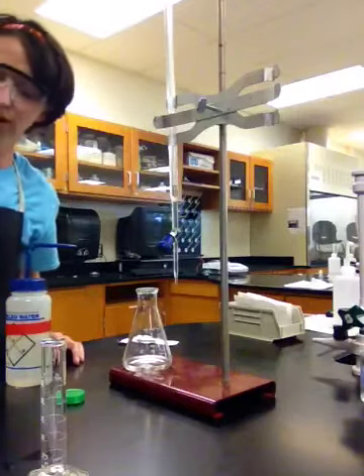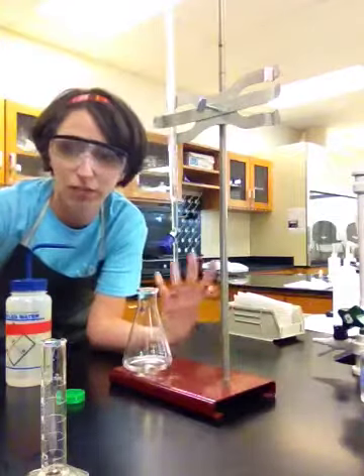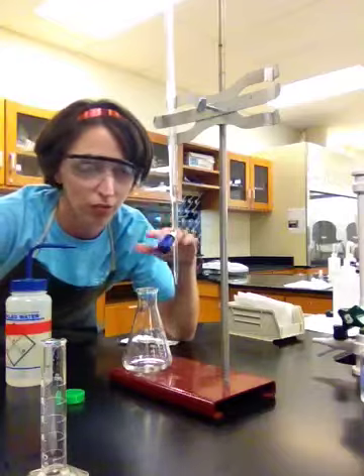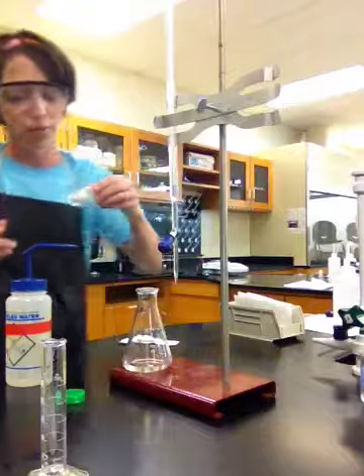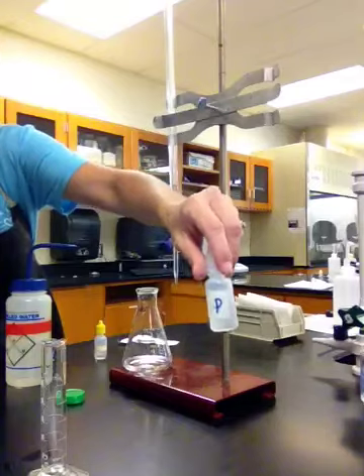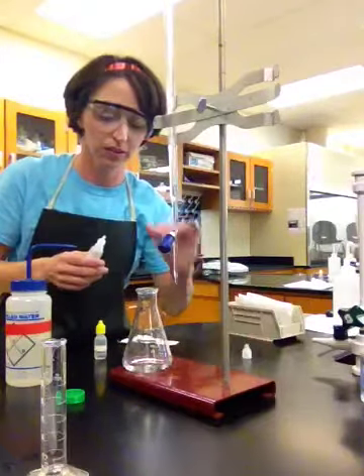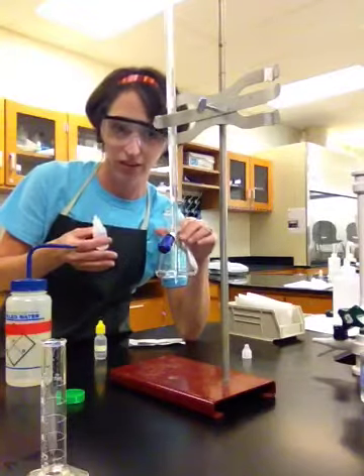Alright, this is absolutely so important. Talked about this yesterday. To do a titration, you have to somehow make it visual. You have to make it clear when you've added enough base to neutralize the acid. You need an indicator. Yesterday we used that really fun one with all the colors, the universal indicator. Okay, it went the colors of the rainbow. Today we're using a much more classical indicator. It's labeled with this P, except it's backwards. But it's called phenolphthalein. Now phenolphthalein is really easy to work with because it's colorless in acidic or neutral conditions, and it's this lovely shade of pink in basic conditions.